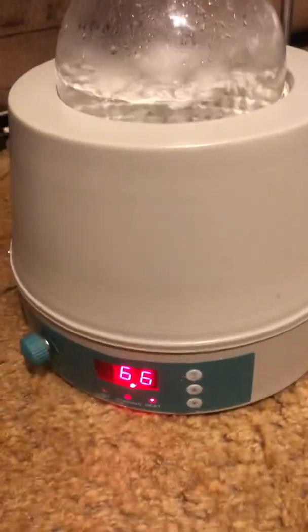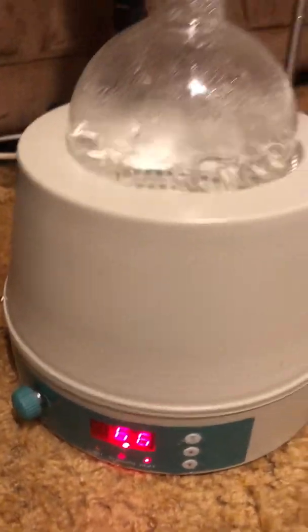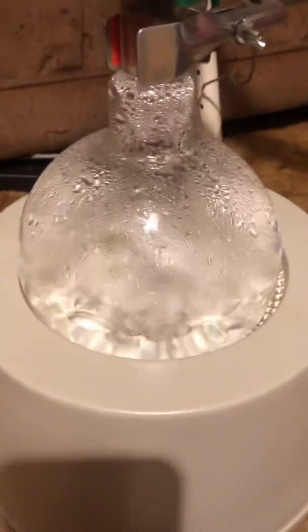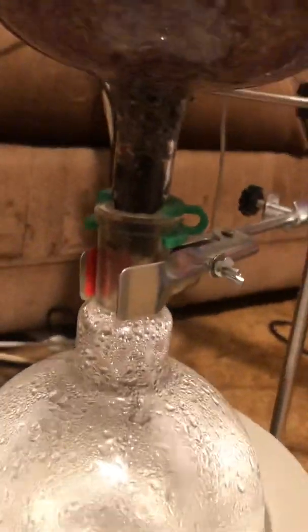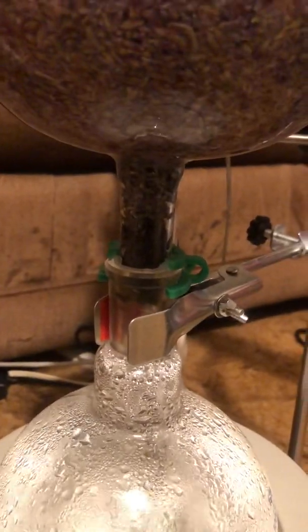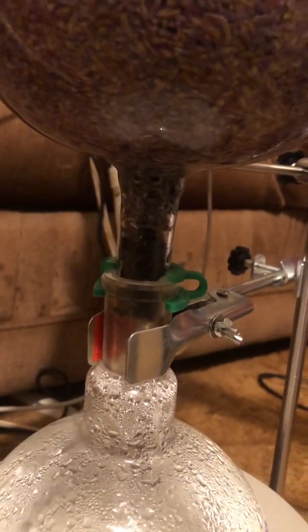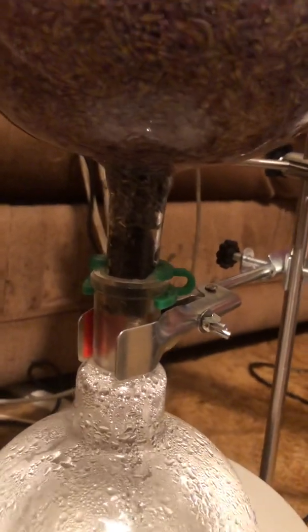This is a 1-liter heating mantle with a magnetic stirrer, and this is a 1-liter boiling flask — it's got two necks so that I can have my thermometer adapter in there. I keep the temperature of the solvent boiling out. Most of my lab setup uses 24/40 joints, keeping most of them consistent — it makes them all compatible and it's a lot cheaper in the end. This is the most common size.